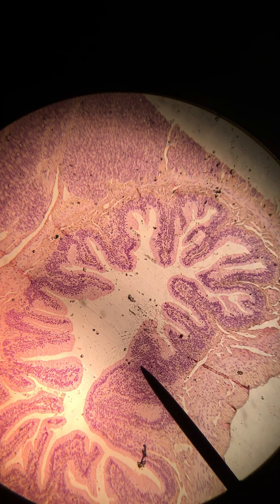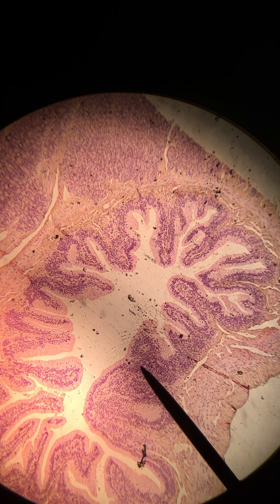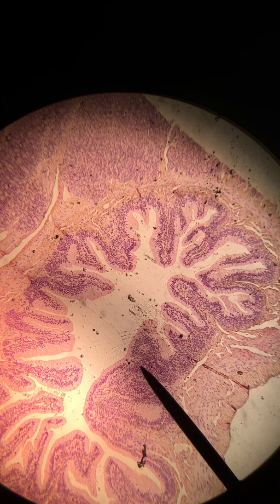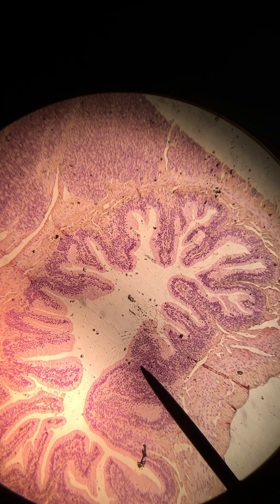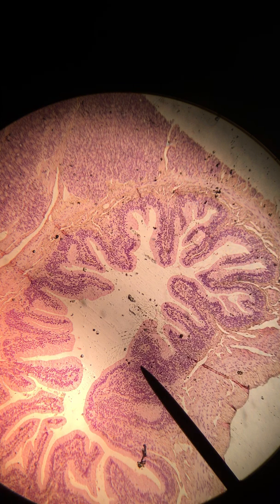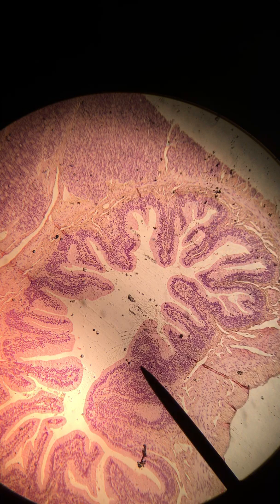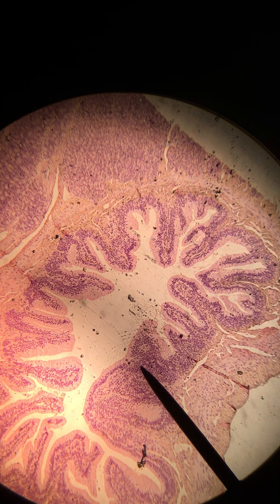This is slide number three for the histology lab — the small intestine. Right now we're looking at the lowest magnification at 40x, and I'll be increasing that as we proceed. I want to give you an overall picture first. You can see the convoluted layers of cells on the inside of the small intestine — all those projections and the increase in surface area created through that folding of the epithelium.